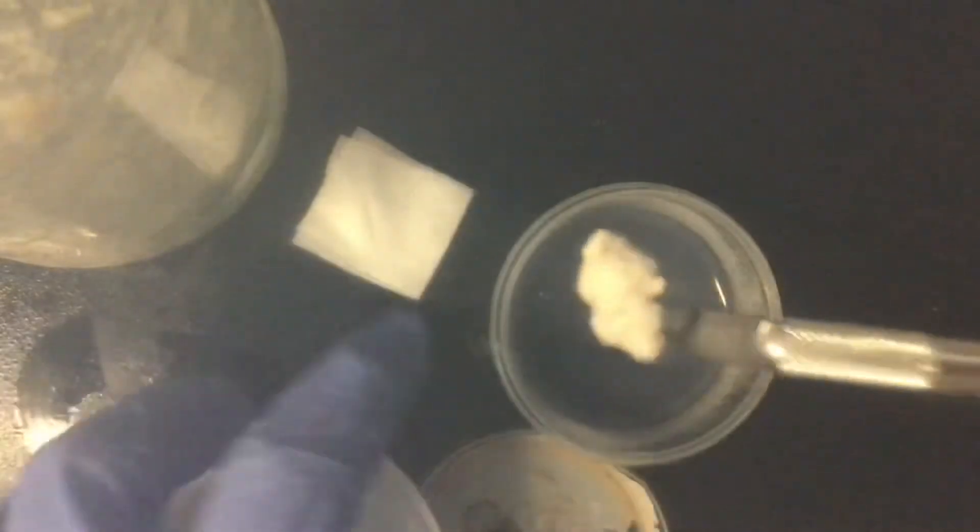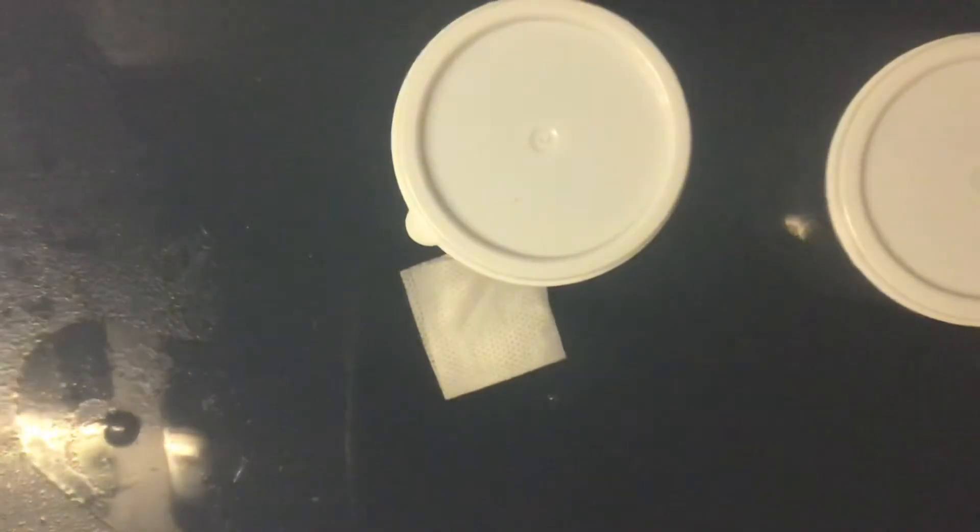All right, let's go down here. So we got a couple pieces of mycelium and one full grain on this one. You guys can't really see it through the condensation, but I put a big heaping log on there — this one's just tiny in the middle. But that was me doing a grain-to-agar transfer.